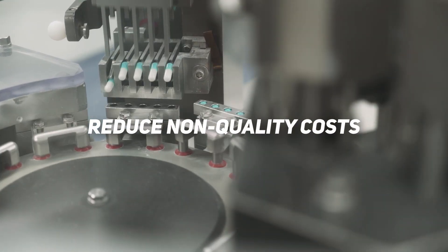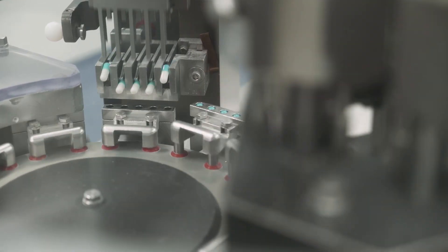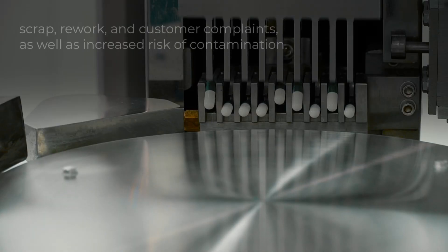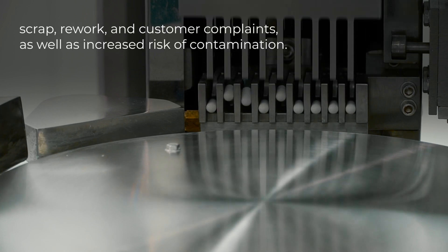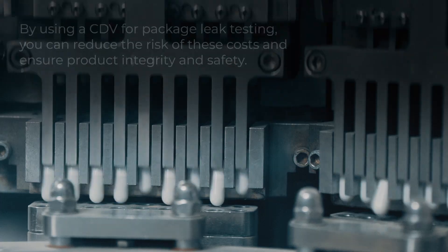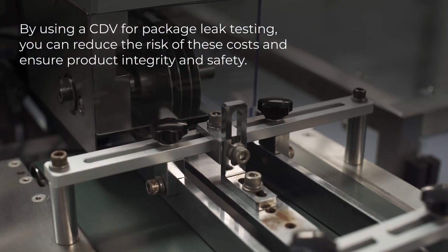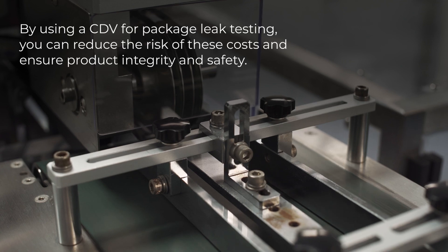Reduce non-quality costs. Packaging defects can result in non-quality costs, such as scrap, rework and customer complaints, as well as increased risk of contamination. By using a CDV for package leak testing, you can reduce the risk of these costs and ensure product integrity and safety.